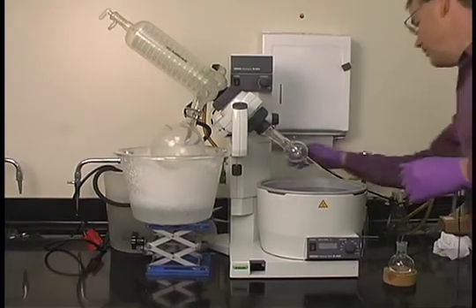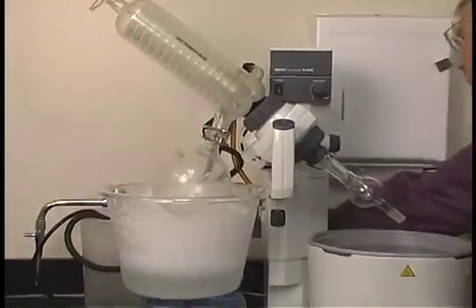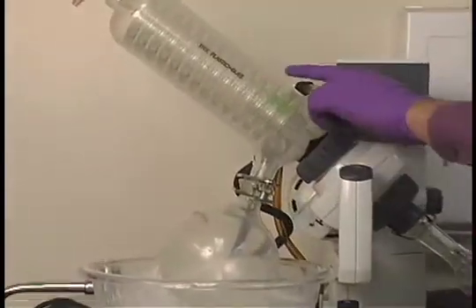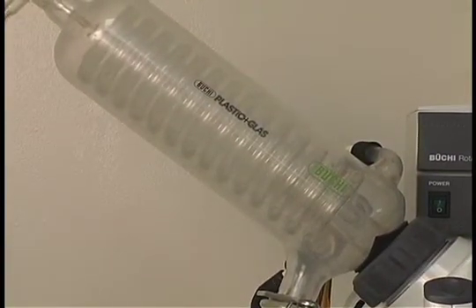When using it, the first thing we need to do is simply plug in the pump that pumps cold water through our condenser. You'll see the water percolate through the condenser once it is plugged in.